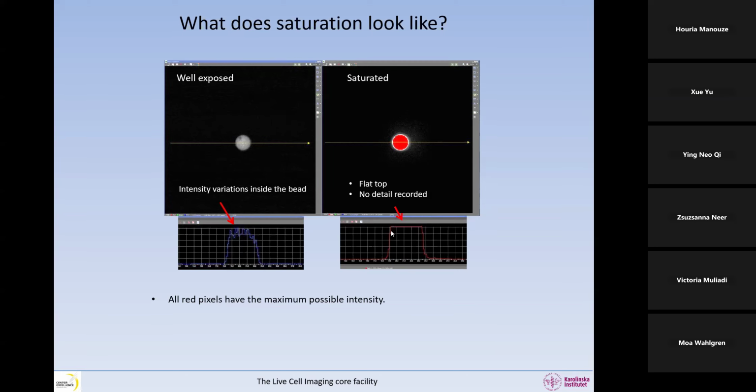However, in a saturated image, if we draw the same line, what we can see is a flat top here. And so the details here are simply not recorded. And all the red pixels have the maximum possible intensity. The intensity information recorded for the saturated pixel is incorrect. It's the wrong information, and we have 0 details.